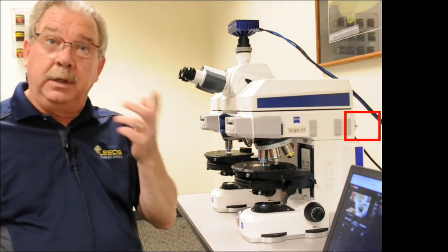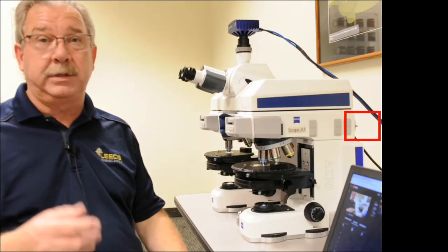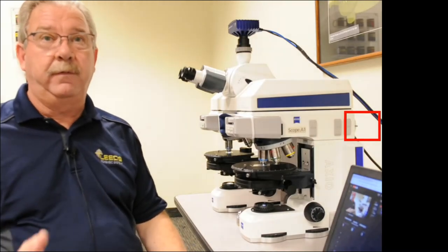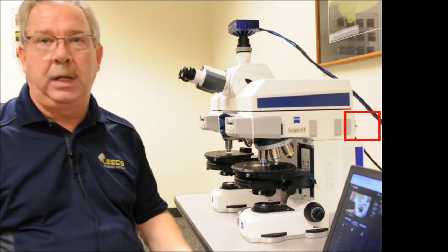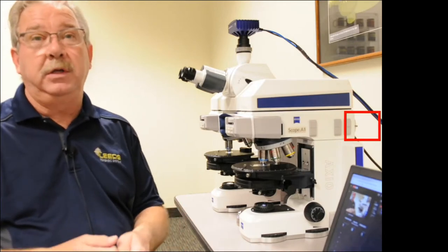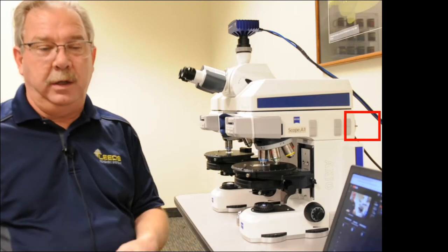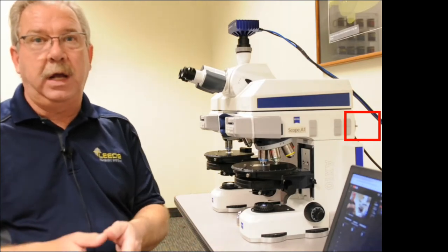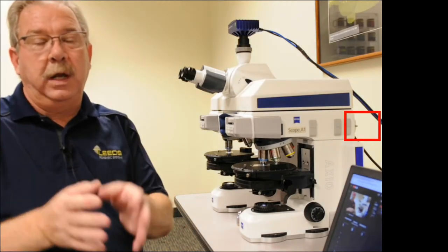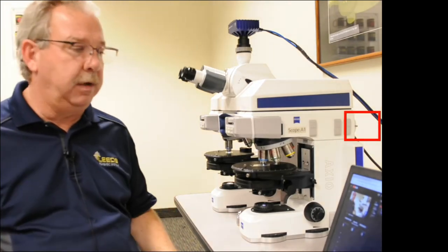It's not something where you can look at a crystal and go, 'it's triclinic and it's negative, so therefore it's olivine.' But with a book, I can walk through a decision tree and narrow down the characteristics of the sample that will help me identify it.